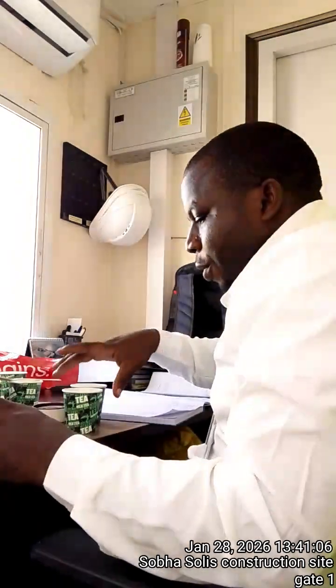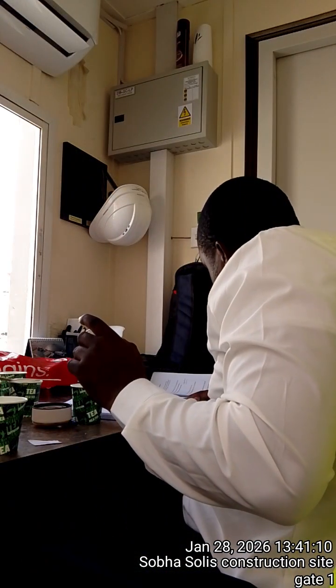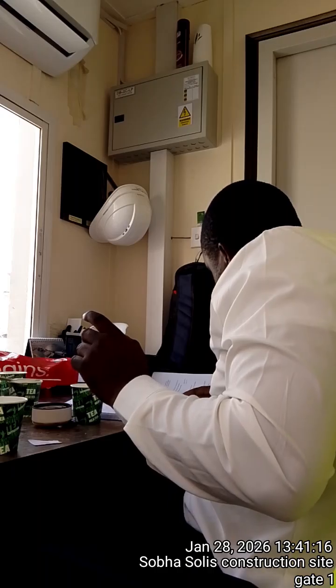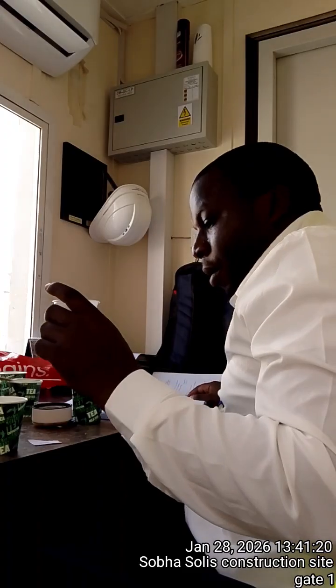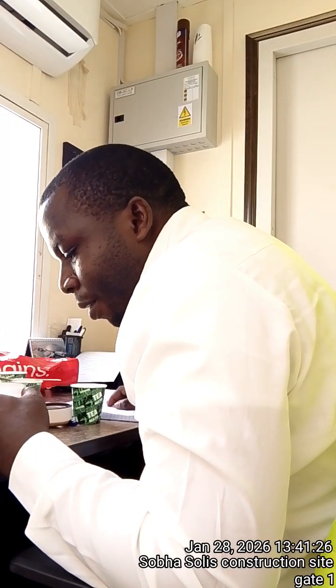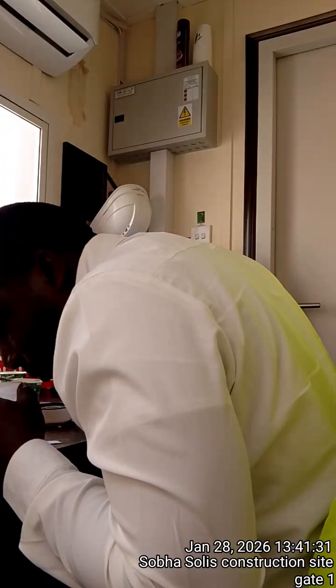Then the third step, they said warm the mixture gently, do not boil. So using this warm water, I'm going to put this. Then they said carefully smell.